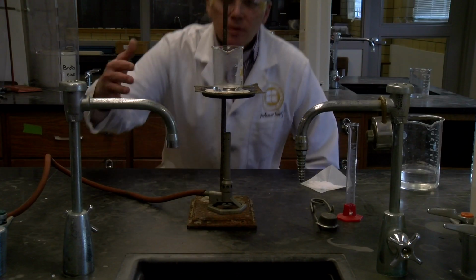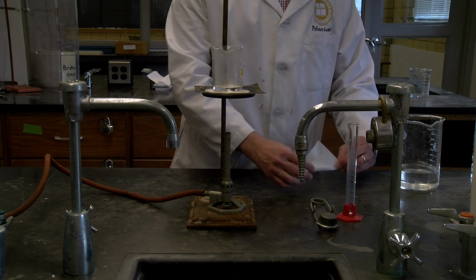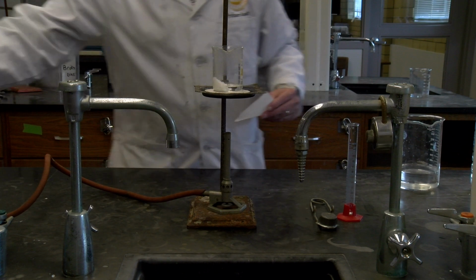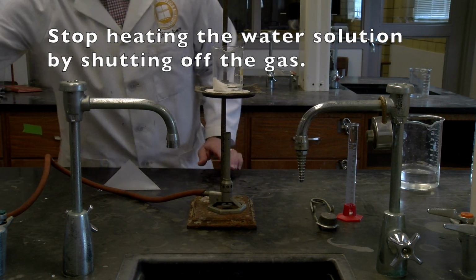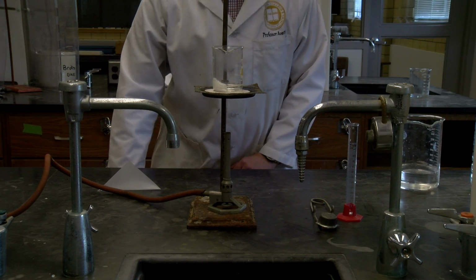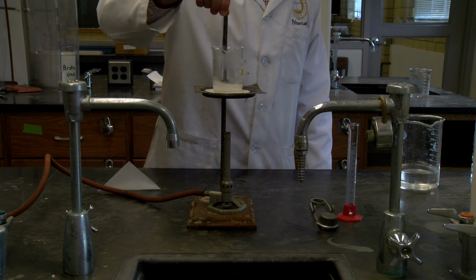Notice we have some bubbles. You can probably see the steam coming off up here. So I would say that that water is just boiling. So I'm going to add this in. Go ahead and turn the burner off, and grab a glass rod. Put it in my beaker here, and stir the beaker.